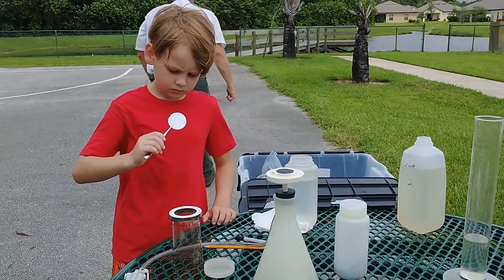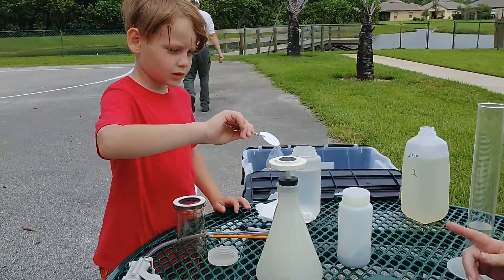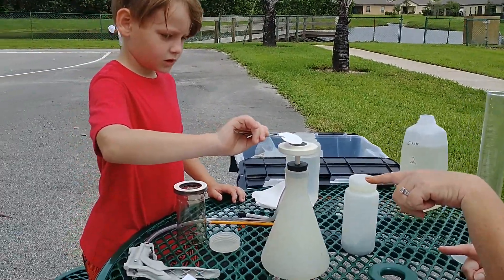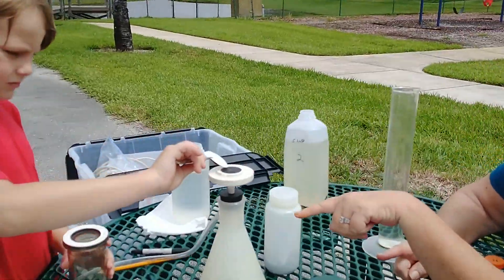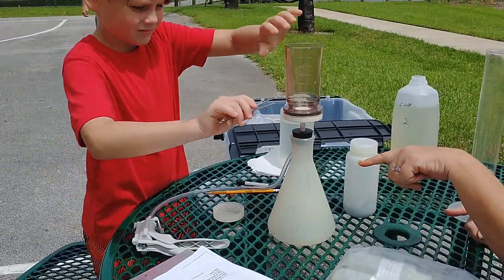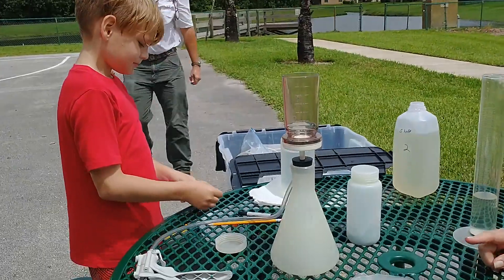Okay, where's the rough side? Just hold it there. Get the other thing on top of it — the one in front of you. There you go. Nice. Good job.